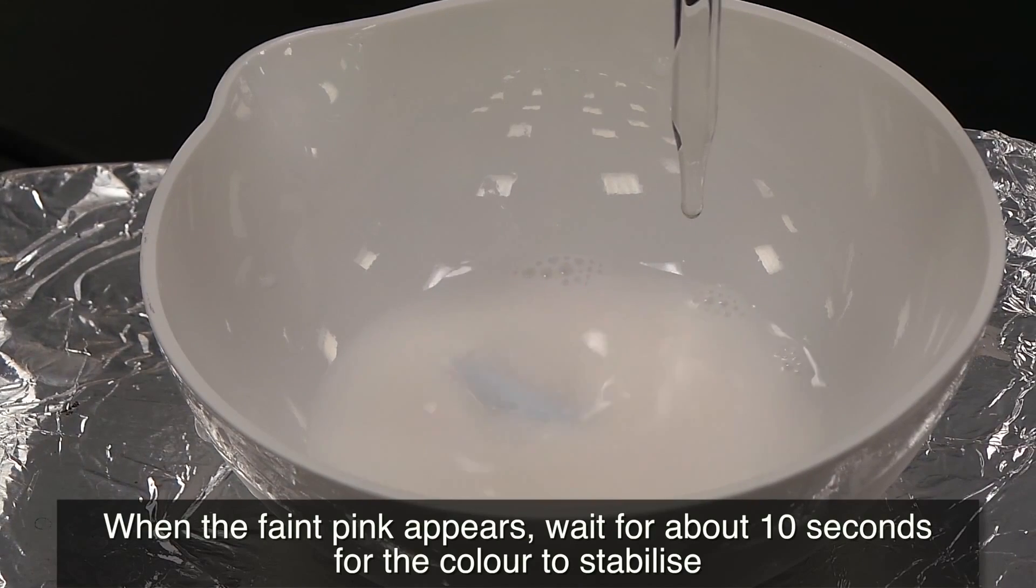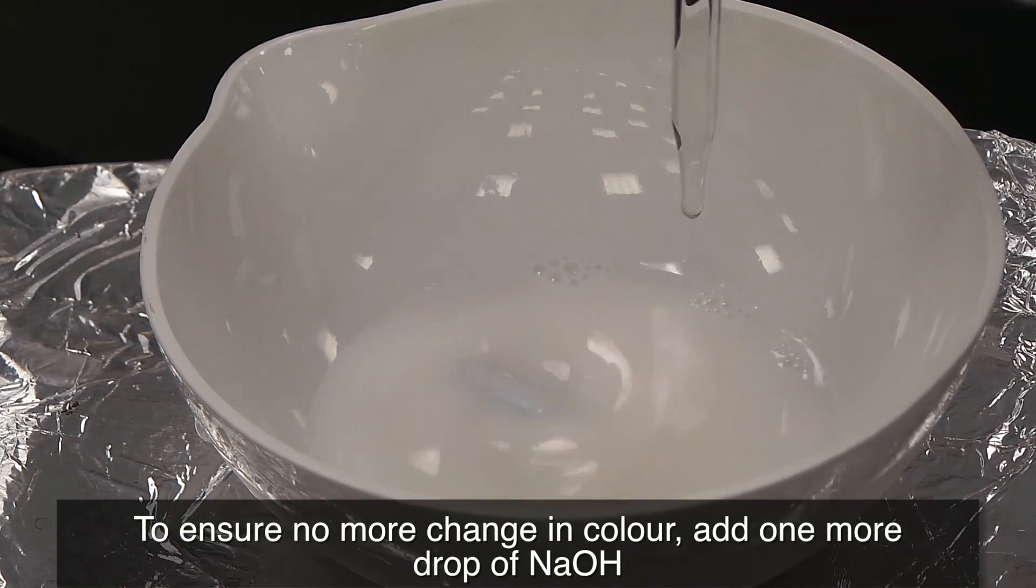When a faint pink appears, wait for about 10 seconds for the color to stabilize. To ensure no more change in color, add one more drop of NaOH.